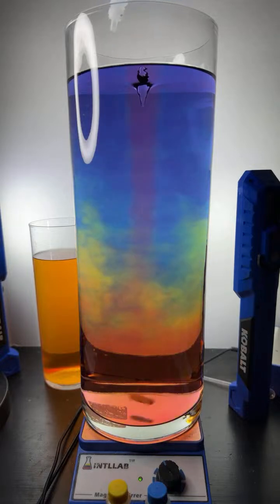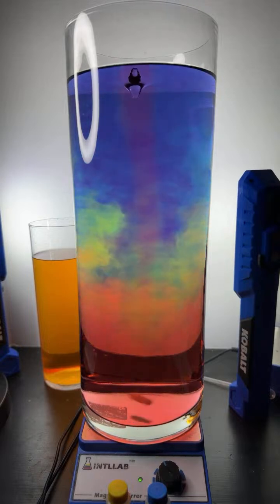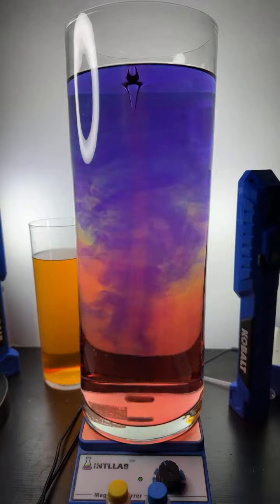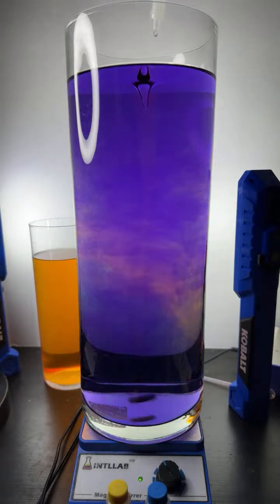Shrey has done a good job encapsulating the experiment. We basically changed the pH in the flask from low to high, high to low. Low means higher acidity. Low pH is, thank you there, Colin. I appreciate the subscription. So yeah, the lower pH values mean higher acidity.